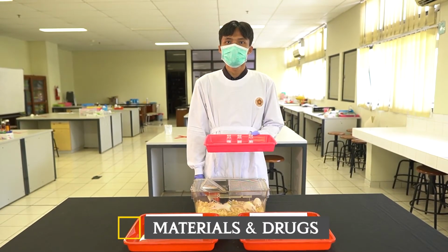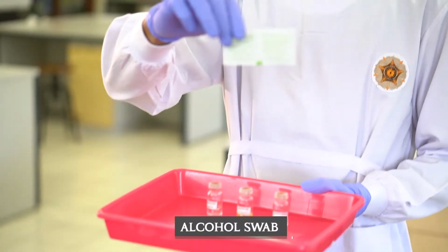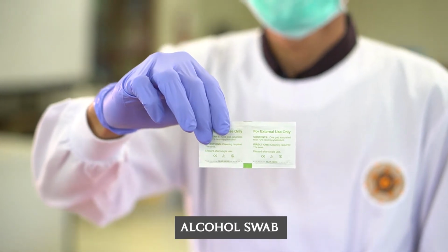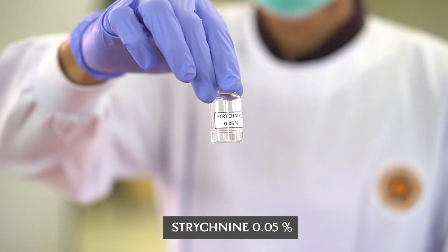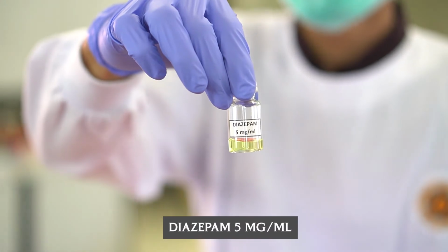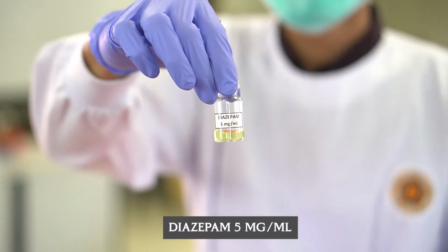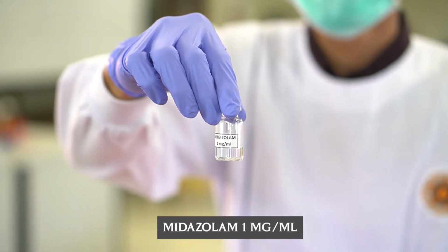Materials and drugs: alcohol swab, strychnine 0.05%, diazepam 5 mg per milliliter, midazolam 1 mg per milliliter.